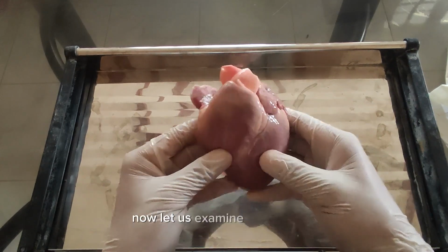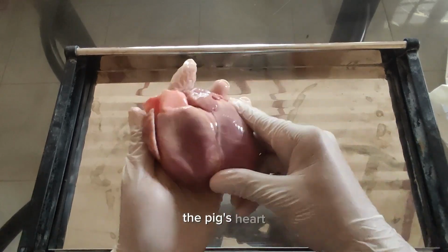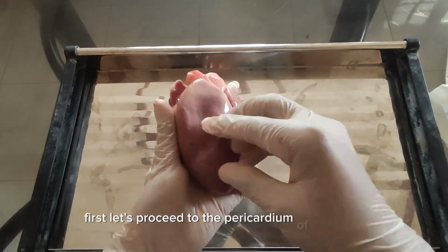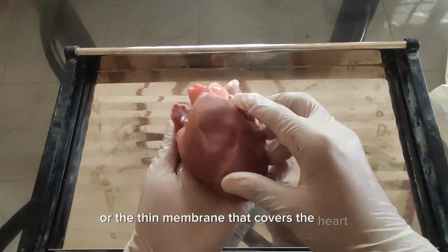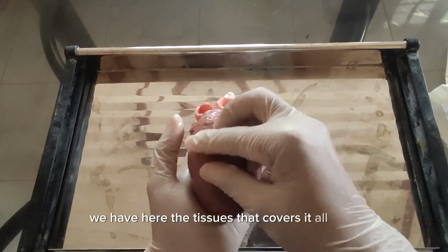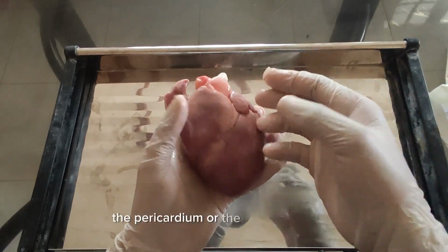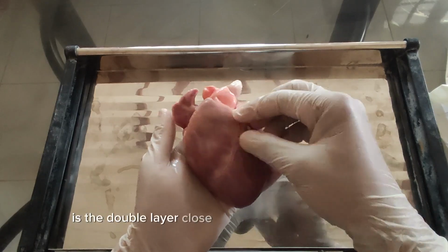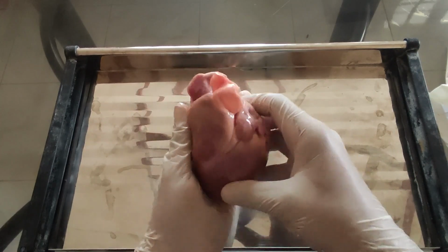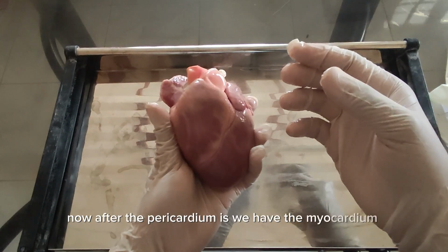Now let us examine the external structure of the pig's heart. First, let us proceed to the pericardium of the heart, the thin membrane that covers the heart. The pericardium is all over the heart. We have here the tissues that cover it all over. The pericardium, or the pericardial sac, is the double layer closed sac that surrounds the heart and anchors it. Now after the pericardium we have the myocardium.